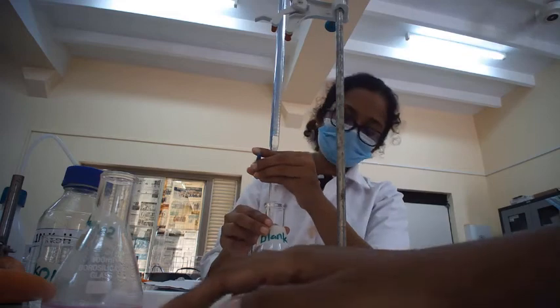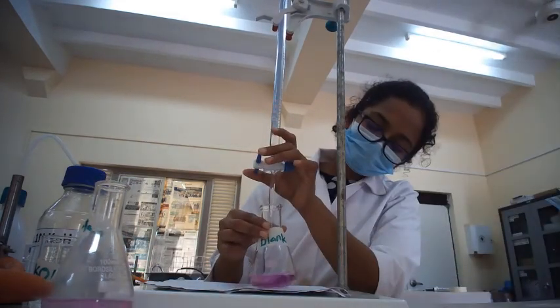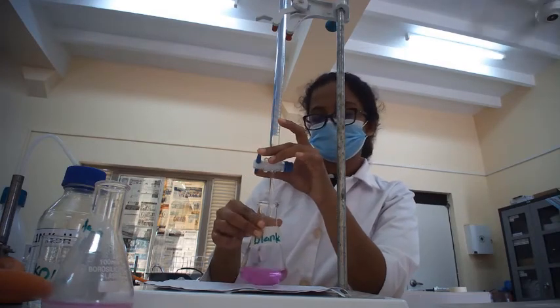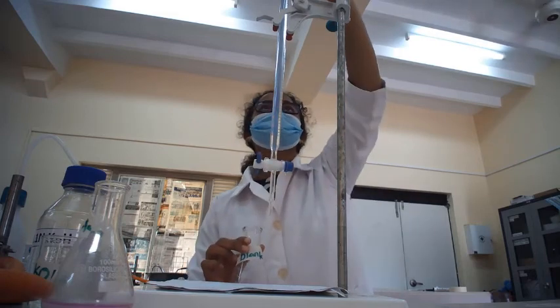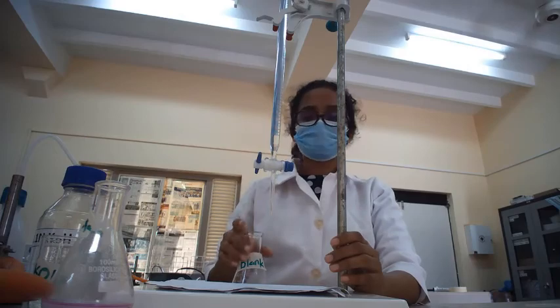Here also you may see we get the persisting pink color, and now we have to record the reading of this burette. Okay.